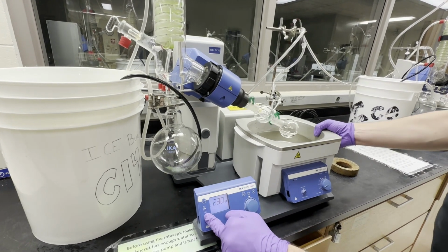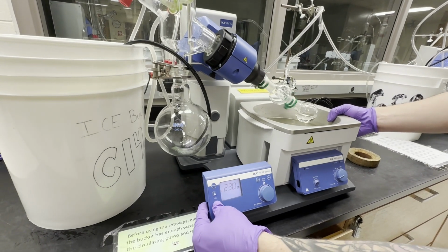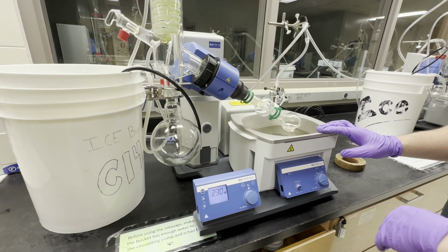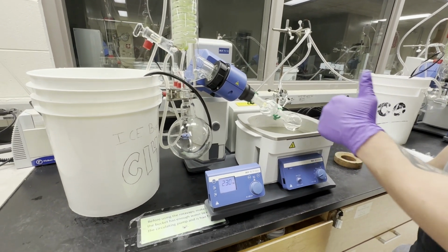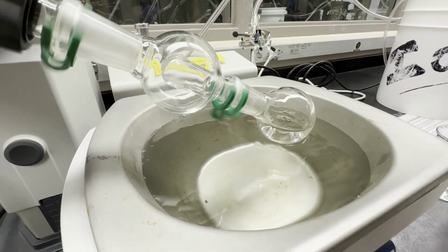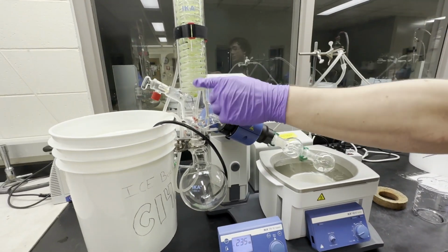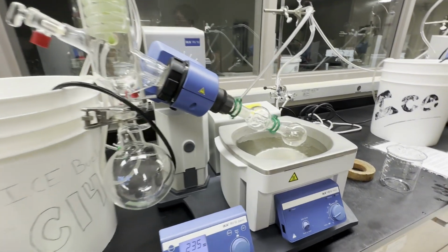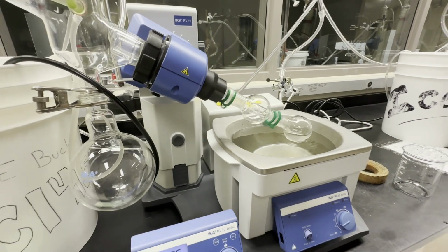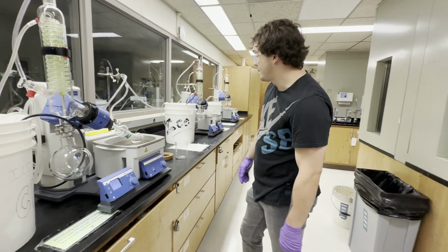Now we're going to try to lower it down into the water. If it goes any lower, I'm going to have to fill this up a little bit more, but you typically want it in the water because this also helps dissipate any heat. All right, and you can see bubbles starting to form, and eventually those bubbles will travel up here, go to this cold column, condense, and be back down there. While this is running, we're going to look at our aqueous solution and process that.